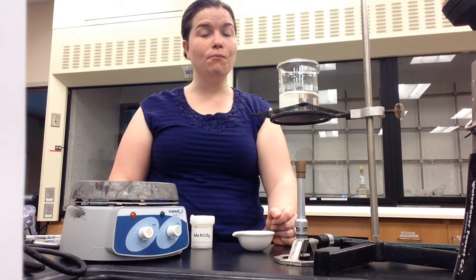All liquid and solid waste produced in this experiment should be disposed of in the labeled waste container in the fume hood. Do not pour chemicals down the drain. The only substance that can be poured down the drain is tap water and pure deionized water.